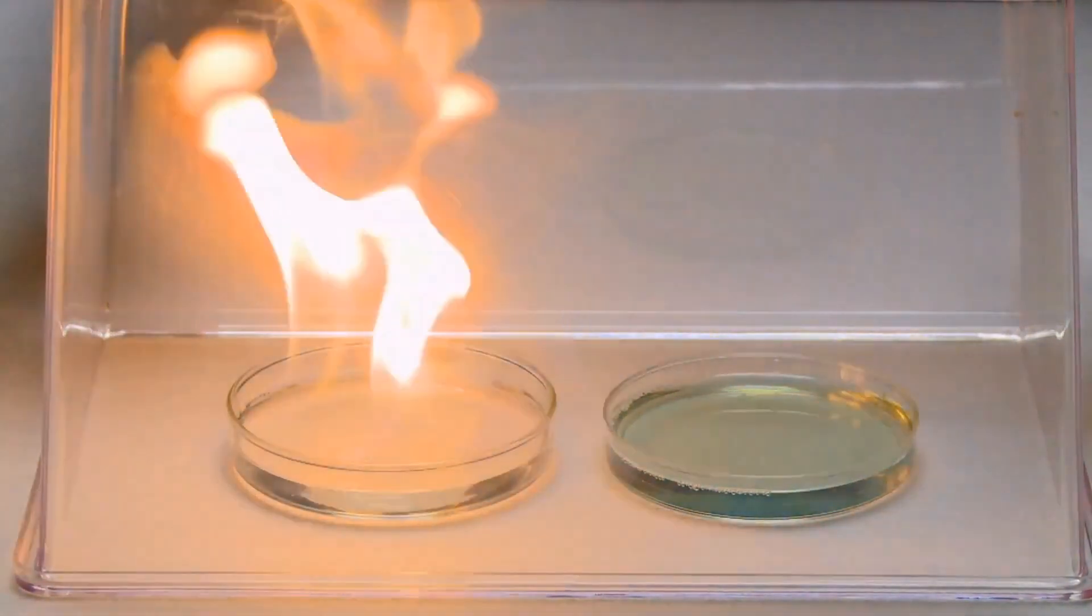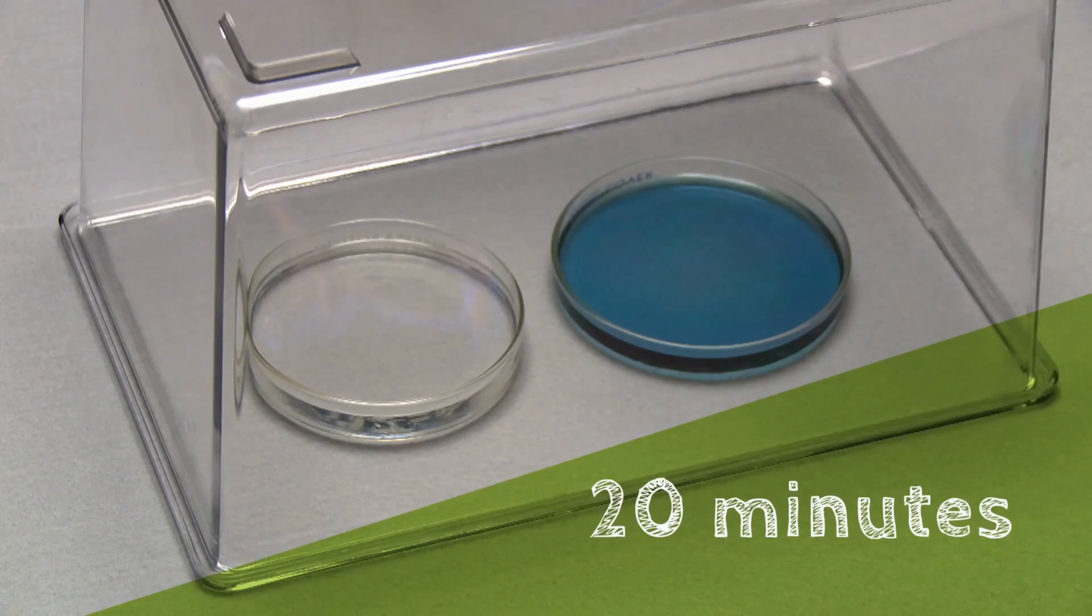The flame goes out pretty quickly. After about 20 minutes, we can check for mass changes and color changes inside the container.